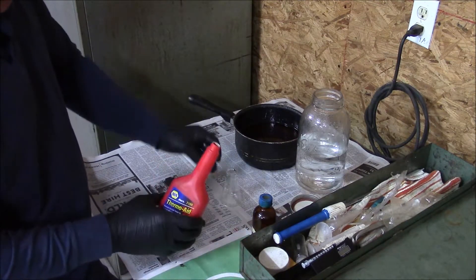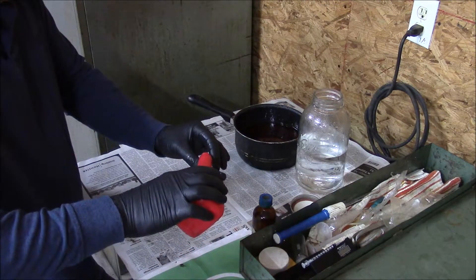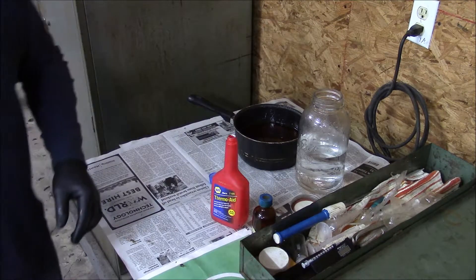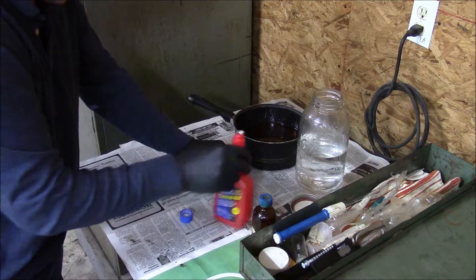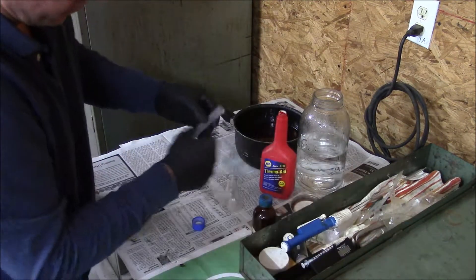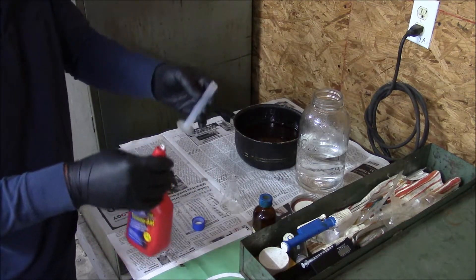The first thing I like to do is wash out my vessel — just kind of wash out any contamination that's gotten in there. I'll put this in the approved disposal container over here. And so we'll start out with 10 milliliters of isopropyl in our container. I've got a graduated cylinder here.